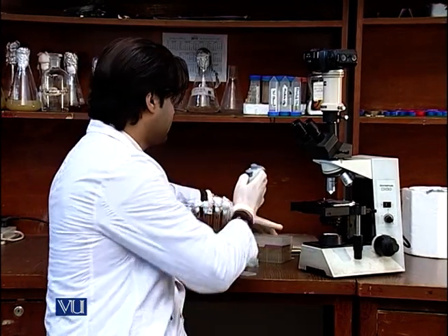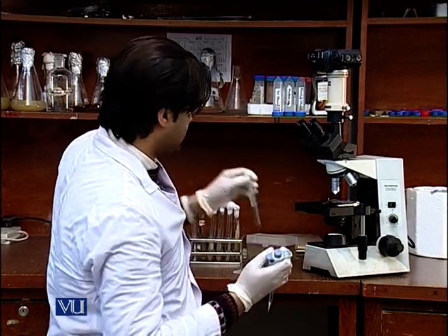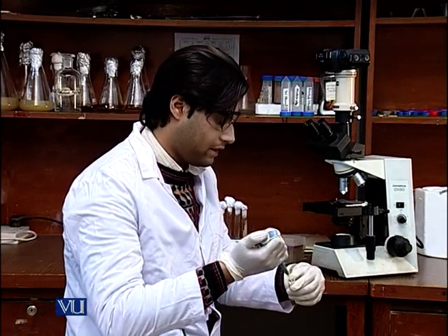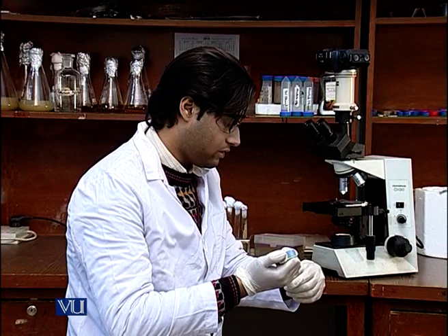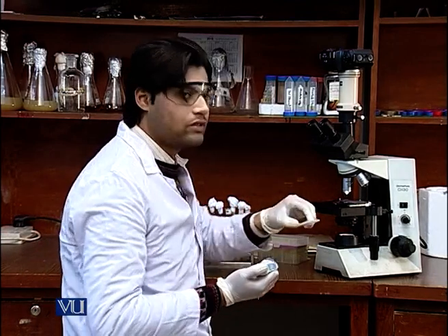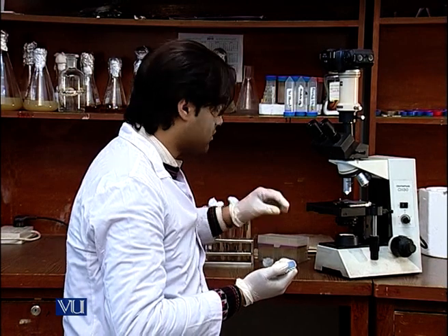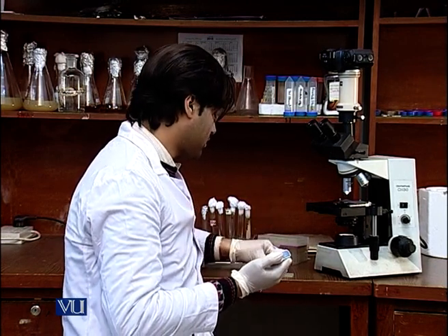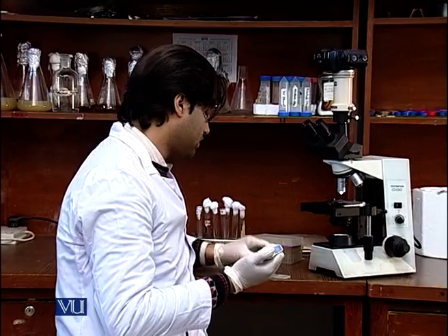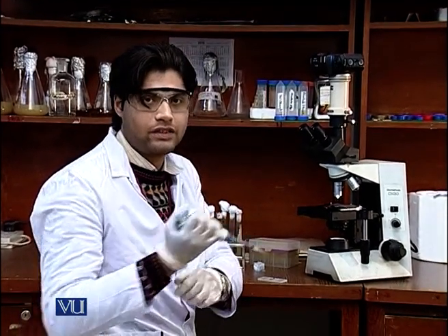I will use a micropipette. First, I will agitate the spore suspension for uniform distribution of fungal spores, then take approximately 20 microliters of spore suspension in the micropipette. I have the improved Neubauer chamber on my desk. I will place a coverslip on one of the chambers where I will perform the counting, and then insert the sample from the tip of my micropipette into that chamber.